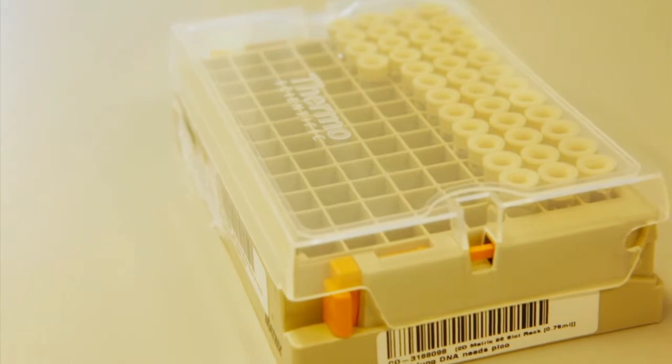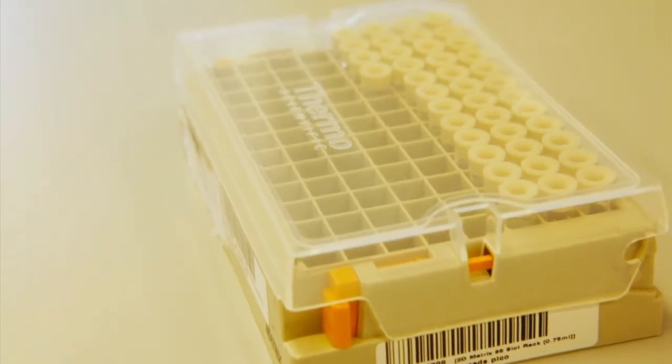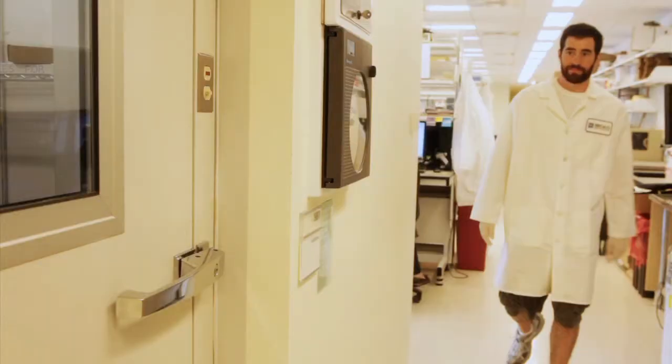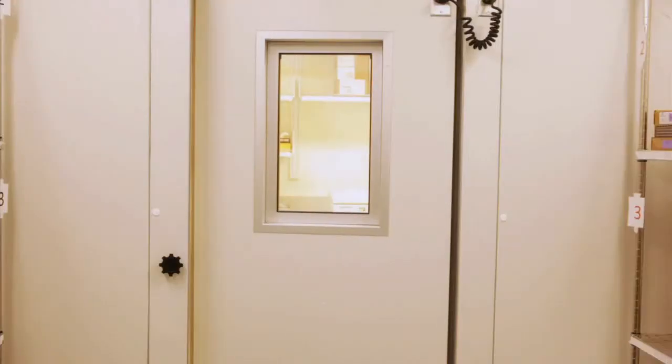DNA has been derived from patients' tumors, but how much DNA does each sample contain? Today, research coordinator Mark Poppo will find out.